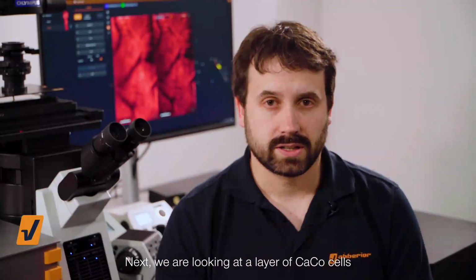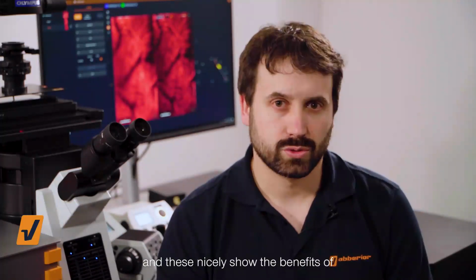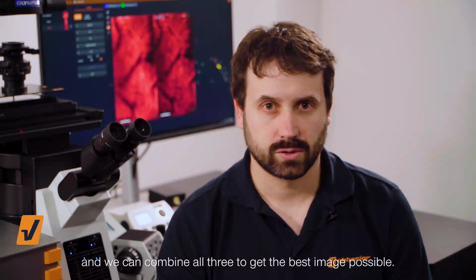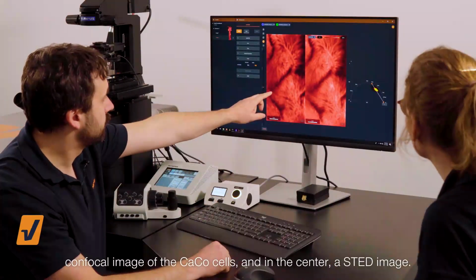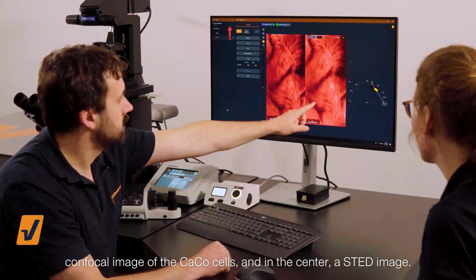Next, we are looking at a layer of Caco cells. And these nicely show the benefits of matrix detection, TIMEBOW, and STED. And we can combine all three to get the best image possible. On the screen, we can see on the left a confocal image of the Caco cells, and in the center, a STED image.